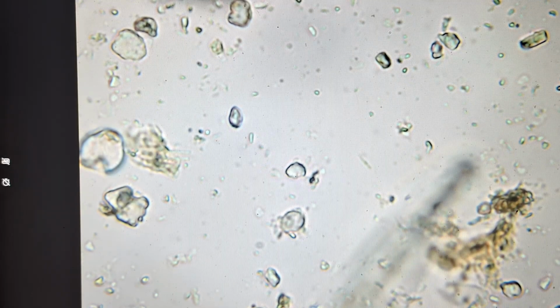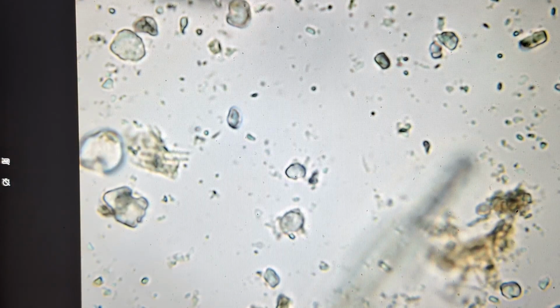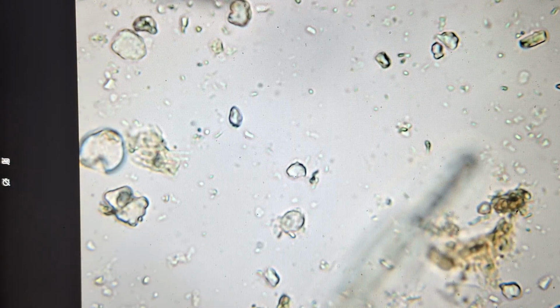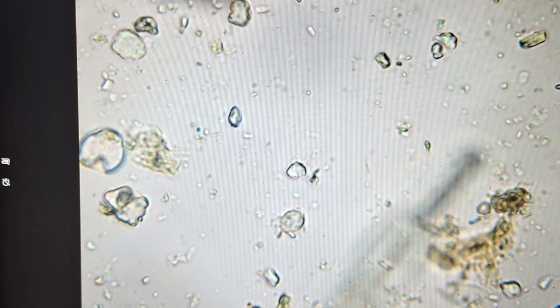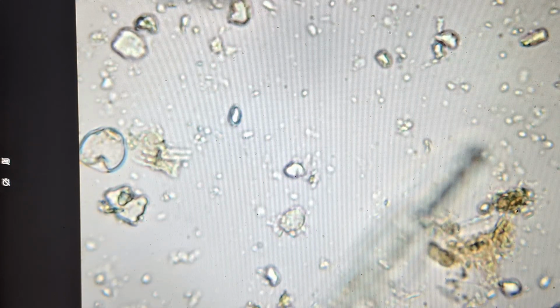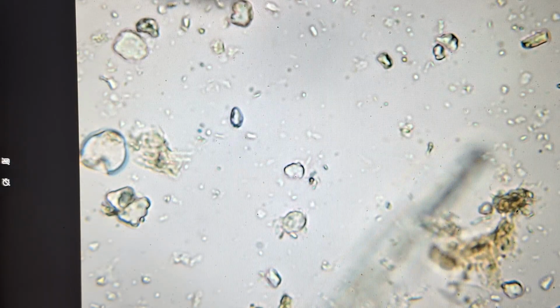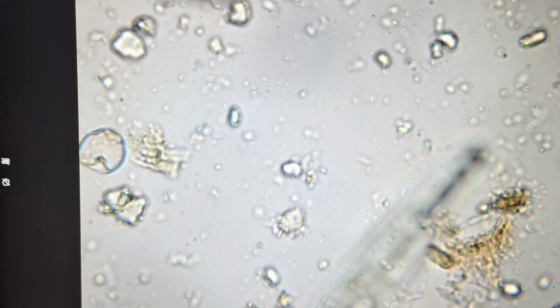Of the three types, we only see the types that show us it's aerobic, as in oxygen, seeing the dots and the rods. Seeing the dots and the rods showing it's aerobic. What we want has oxygen in there. If there were swimming ones, those would be spirilla, showing us it's gone anaerobic or on the edge of it.